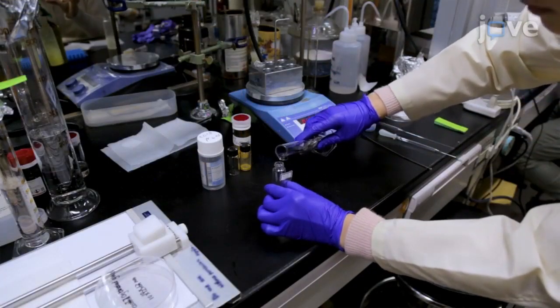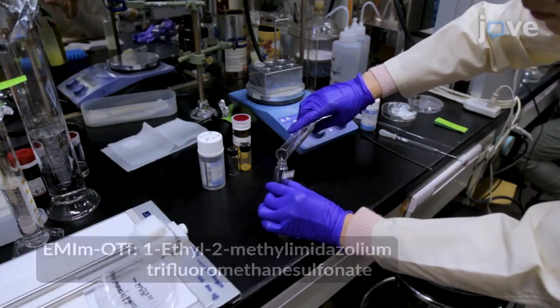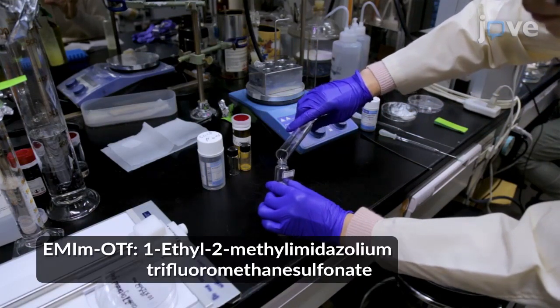In a separate vial, dissolve 12.9 mg of EMIM-OTF in 10 ml of dichloromethane.